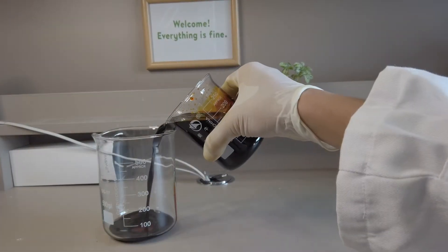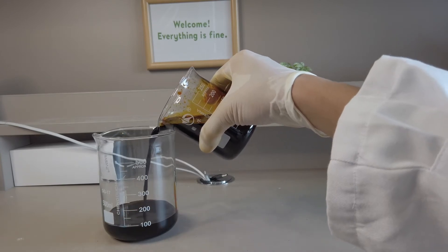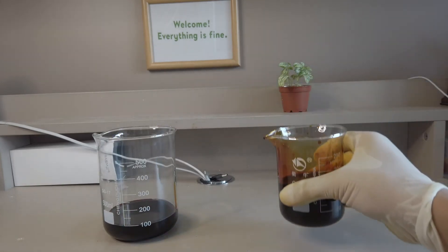A hundred milliliters of povidone iodine was transferred to a larger beaker followed by an excess amount of sodium hydroxide solution.